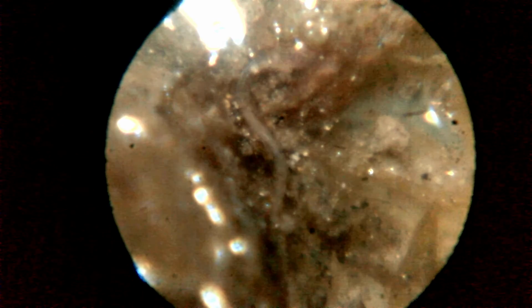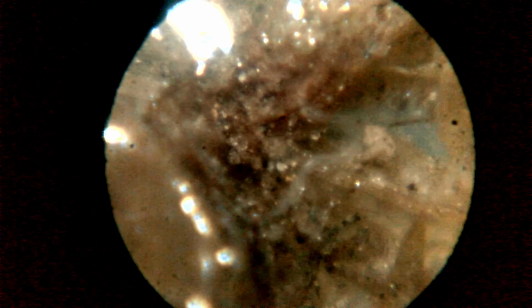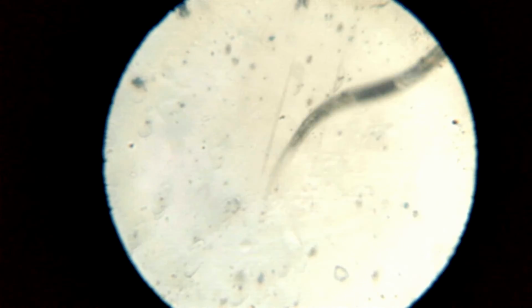The organism that is plowing through the plant material here is a nematode, a tiny worm. They are everywhere actually and very easy to find. Here's another one. And here's an extra big one.